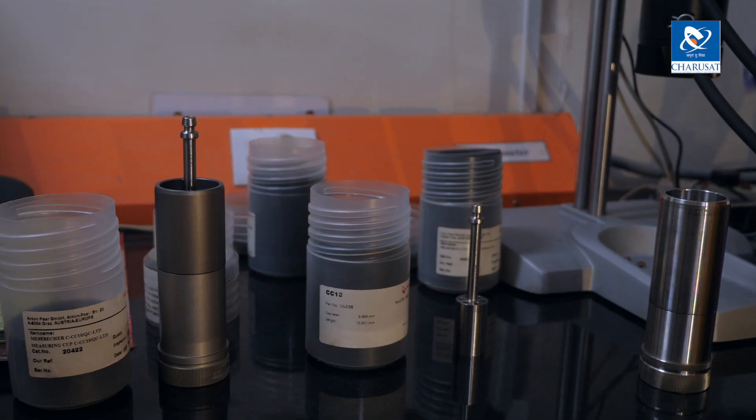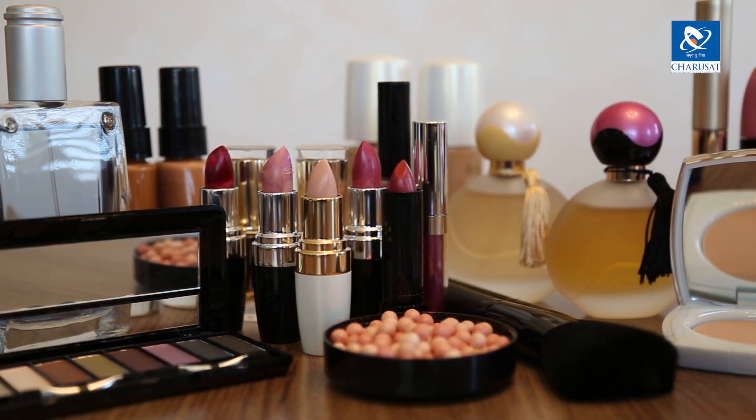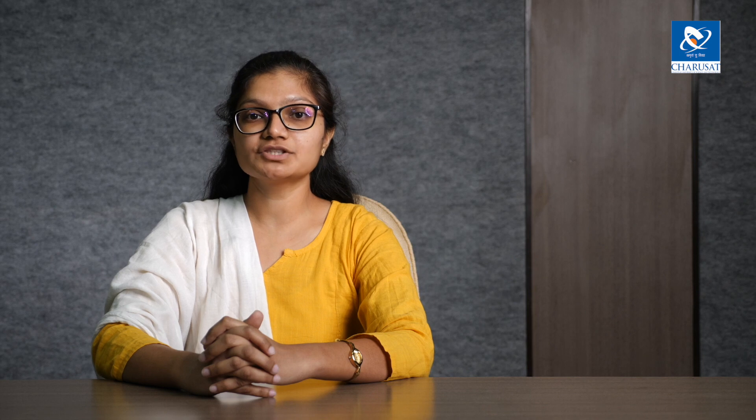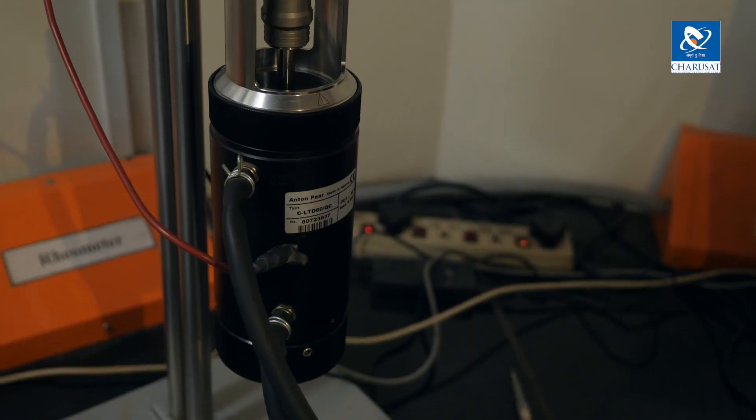There are many materials which can be characterized using this rheometer. For example, polymers, adhesives, coatings, paints, printing inks, cosmetics like cream, lotion, hair gel, foodstuff like baby food, cheese spread, tomato ketchup, petrochemicals, oil, grease, etc. All these materials can be characterized using this instrument.